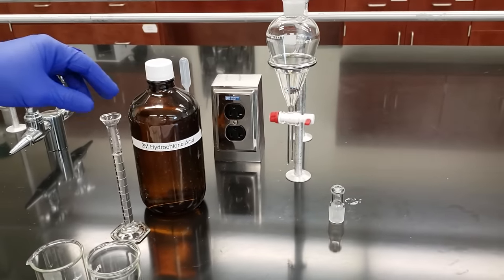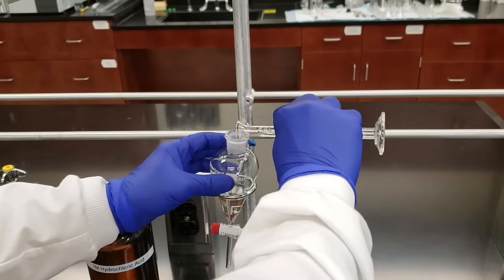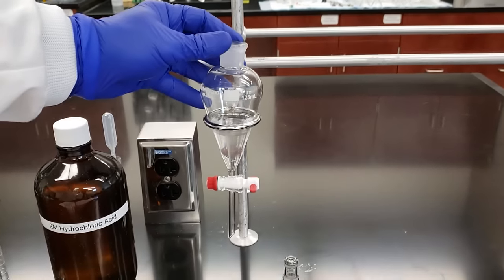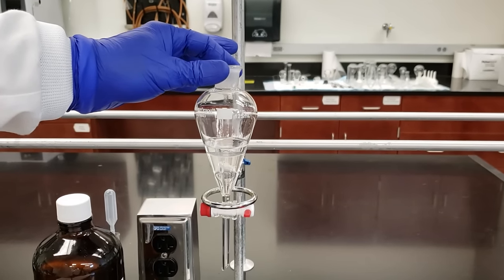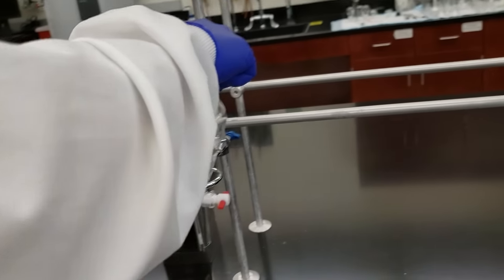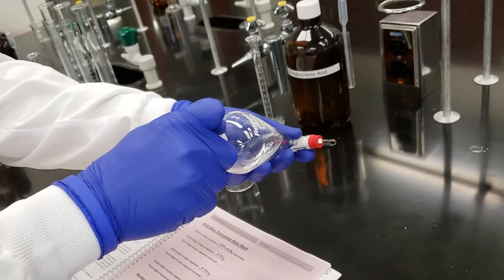To do this, just like we saw in the flow chart, we're going to take 10 mL of 2 molar HCl — hydrochloric acid — and add that into our sep funnel. So now we have an organic layer, which is our methylene chloride, and an aqueous layer, which is our 2 molar HCl. We can see our layer separation. We're going to extract this. To do that, we put our stopper in the top, remove it from the ring clamp, and shake — keeping my hand firmly on the stopper so it doesn't come free.